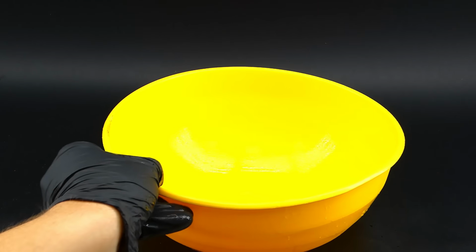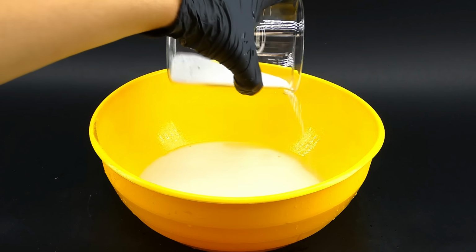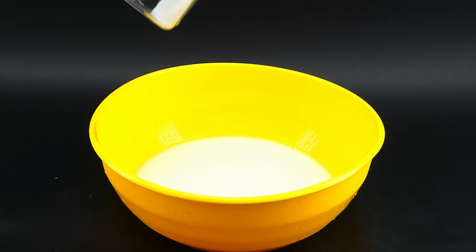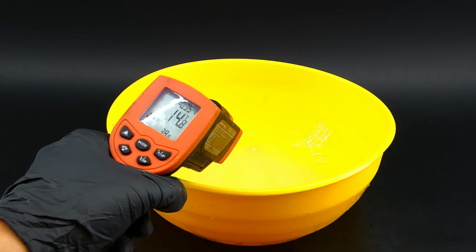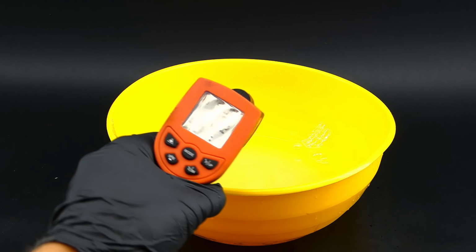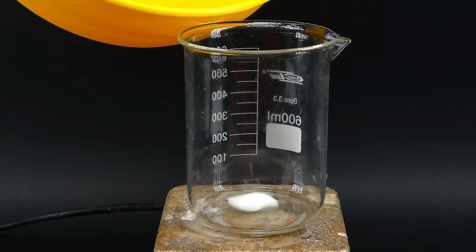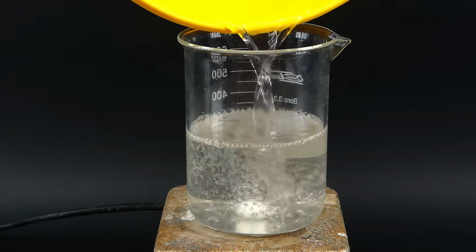I didn't want to repeat the hot plate incident, so I got a big plastic bowl, poured in all of the vinegar, and added the remaining baking soda all at once, which didn't have any bad consequences, and I am now wondering why I didn't do that in the first place. The whole mixture also cooled down a lot, since this reaction is endothermic, and when the bubbling stopped, I poured the whole sodium acetate solution back into the beaker, and now I had to evaporate all of the water.